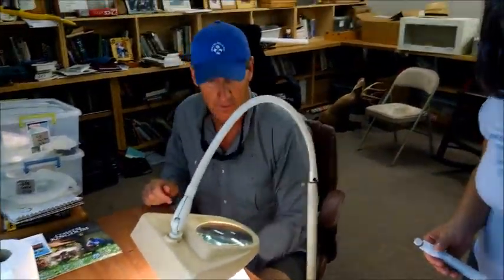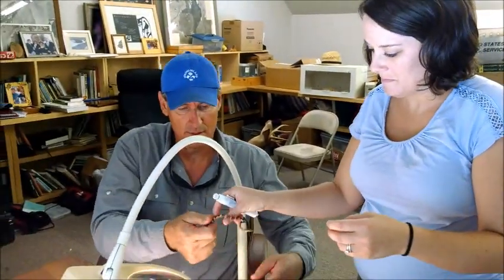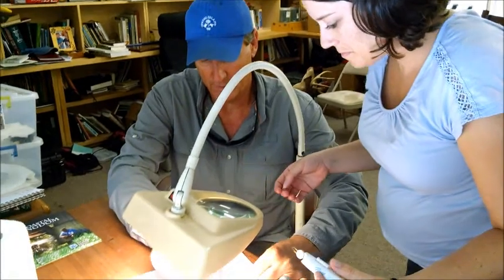Let's do another one. It's kind of hard to mark a snake and hold it at the same time.